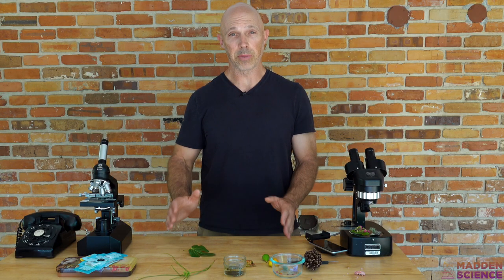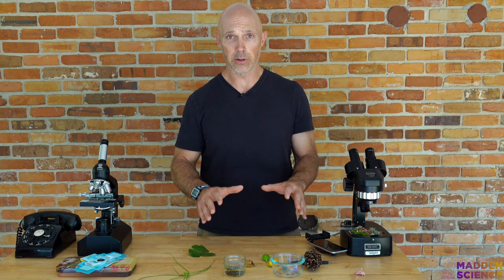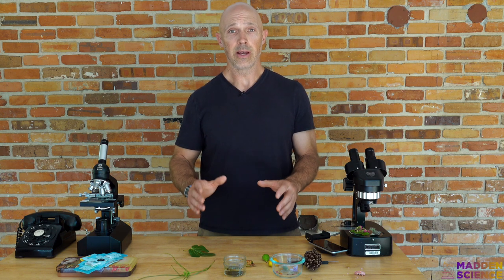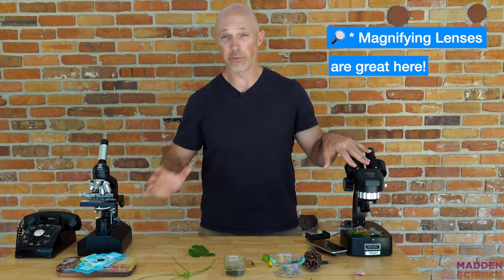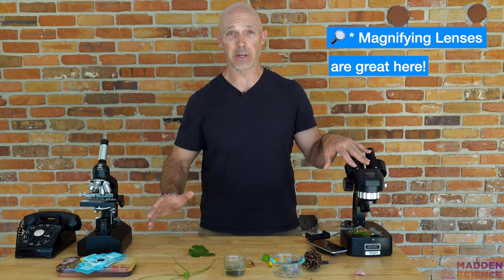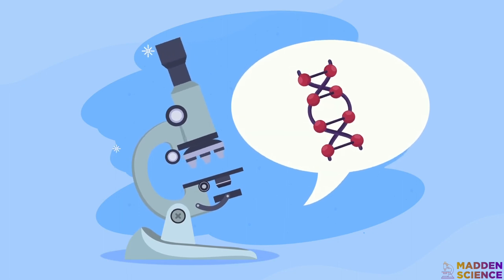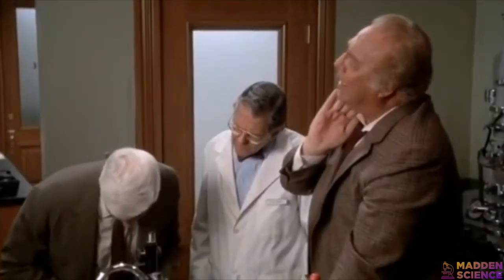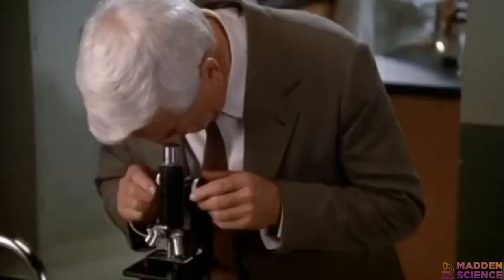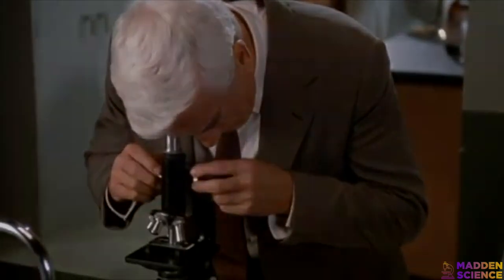We'll start where most good learning begins — with play and exploration. Simply look around at your specimens and check them out under different magnifications. Look at your friends' specimens. Now this all assumes that you know how to properly use a microscope. Use your open eye, Frank. Oh yeah, I can see it now.